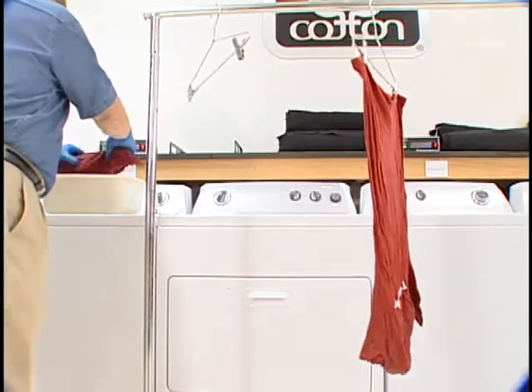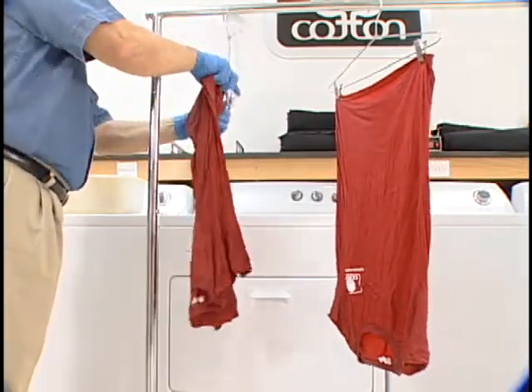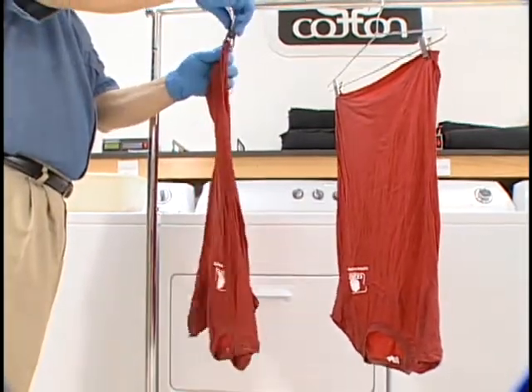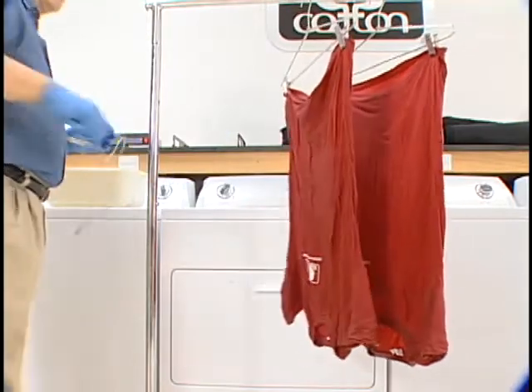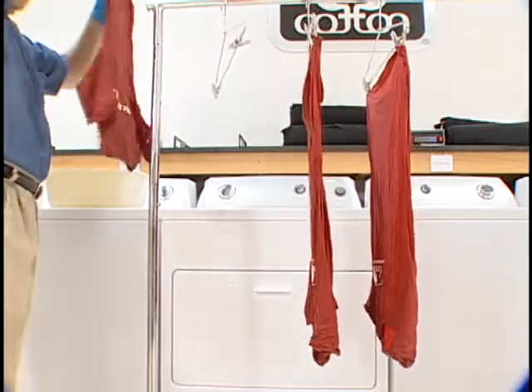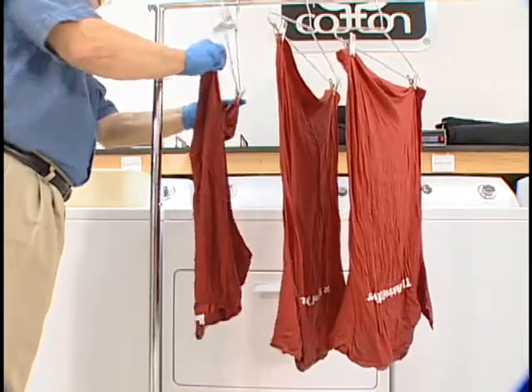For specimens to be drip dried, remove the specimens from the washer just before the water begins to drain for the final rinse cycle. The soaking wet specimens are hung with the fabric length in the vertical direction. If washer creases or folds have occurred, they should be removed by hand prior to drying. Care should be taken not to stretch or distort the specimen. Allow the specimens to hang in still air at room temperature until dry.